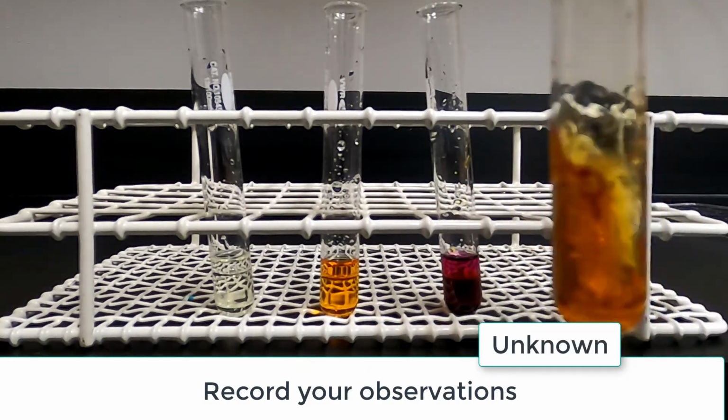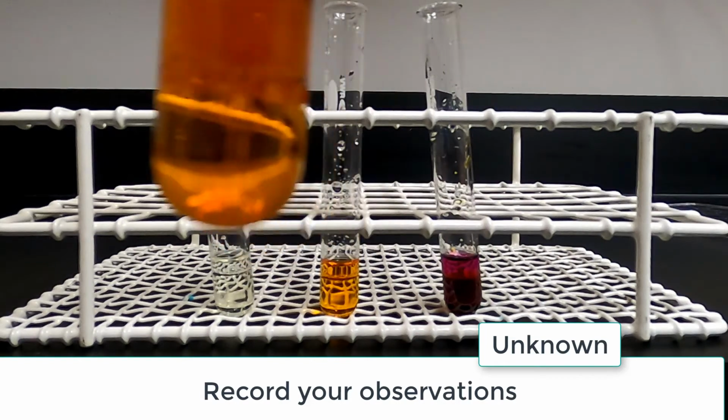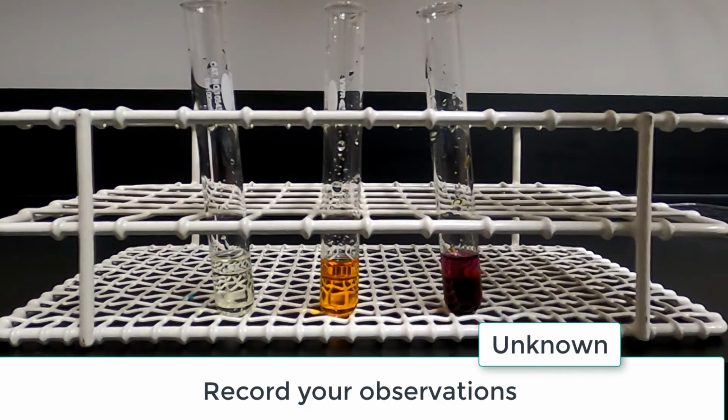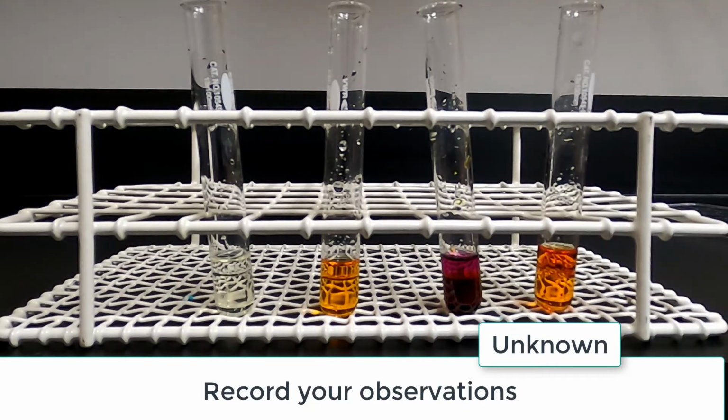Based on your observations, what is the identity of the unknown? To clean up, dispose of the solutions in the liquid hazardous waste container. Rinse each test tube with a small amount of water into the hazardous waste container. Wash the test tubes with soap and water and return them to the proper location.